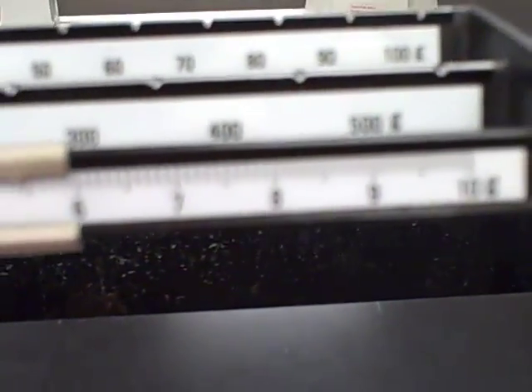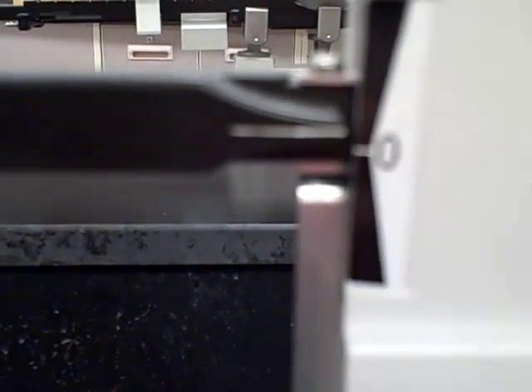Then I'll fine-tune it with the small. It's up near 140. I'm going to slide that over quite a ways. I'm getting close now. A little more. That's about right, right there.